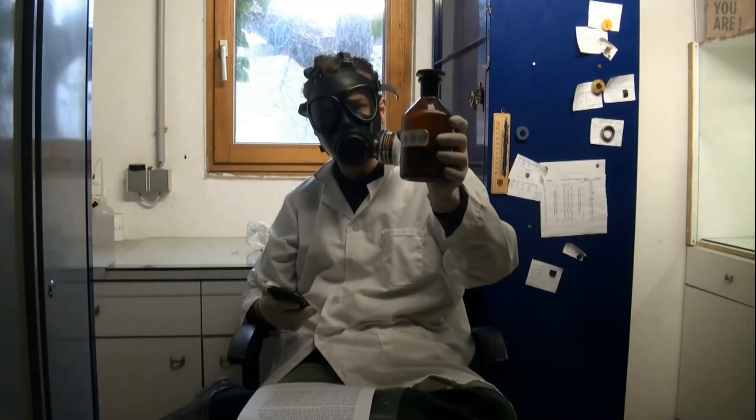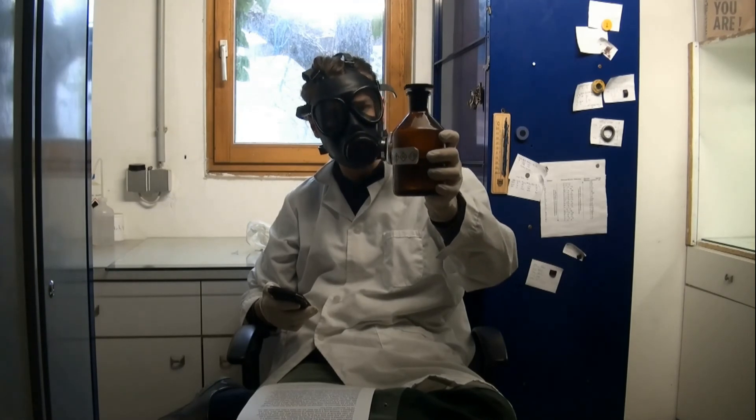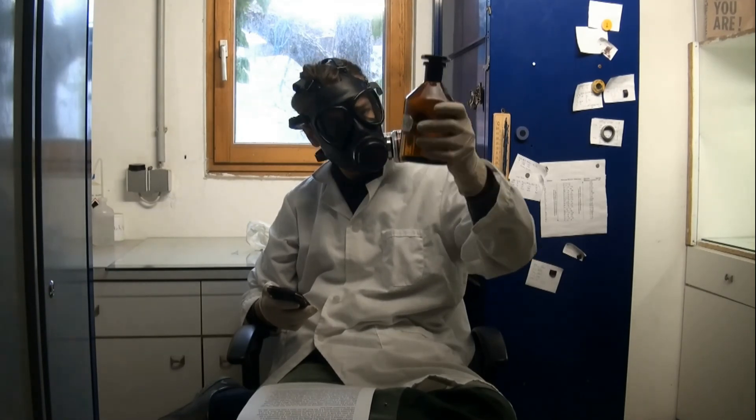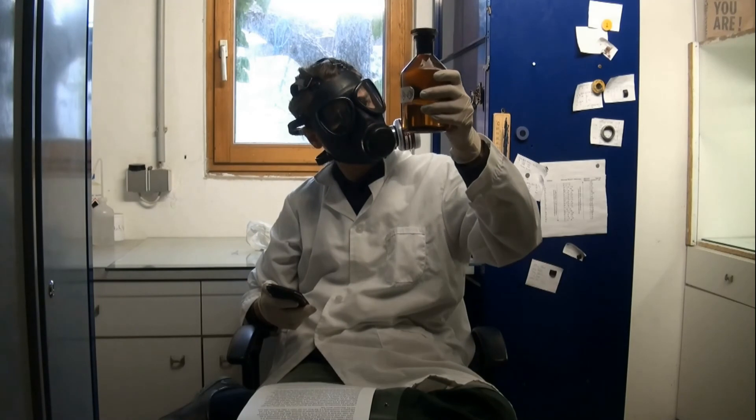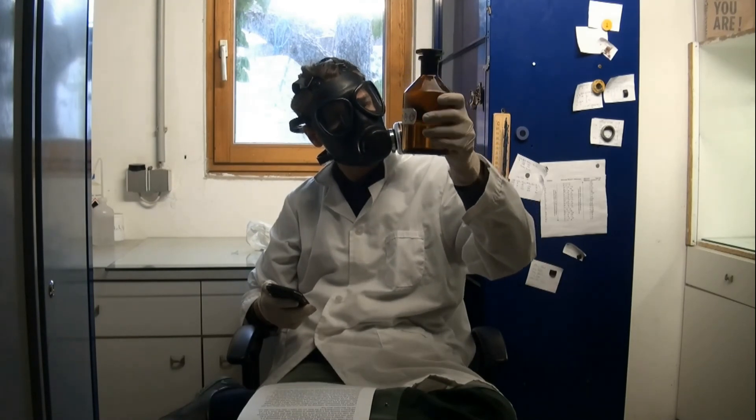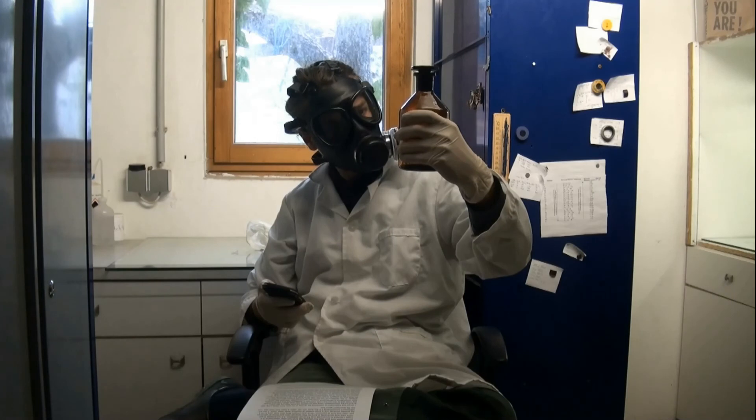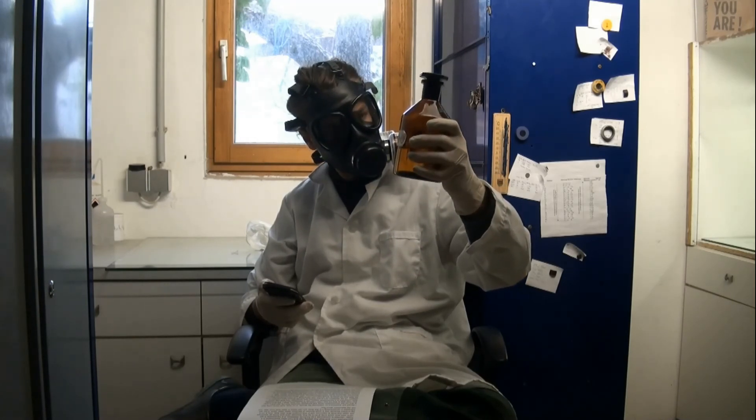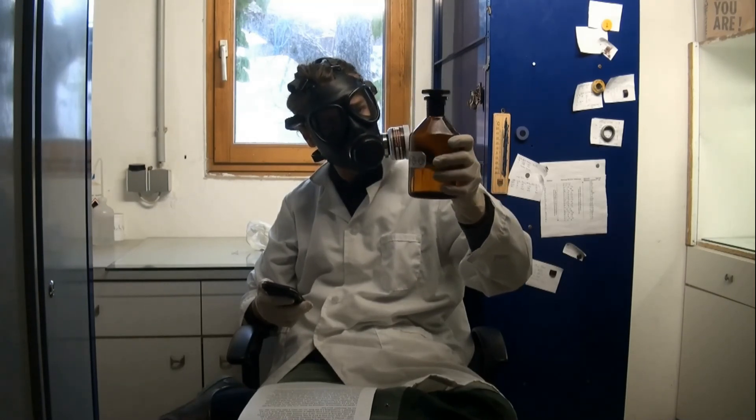I finally was able to make a little bit more nitric acid for my nitric acid flask. I only have about 250 milliliters in here that I will soon use to make some nicely nitrated compounds.